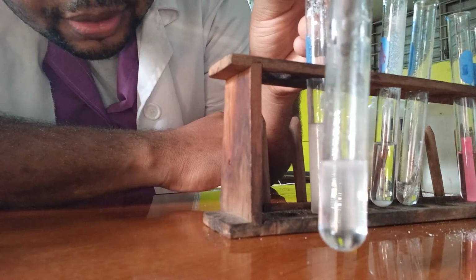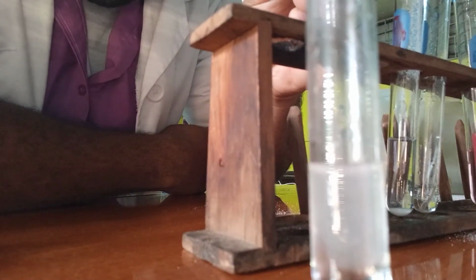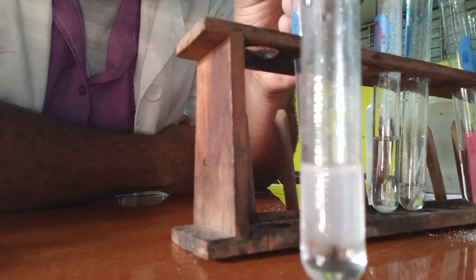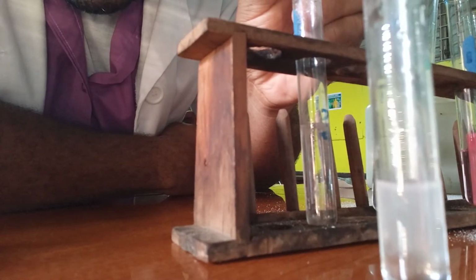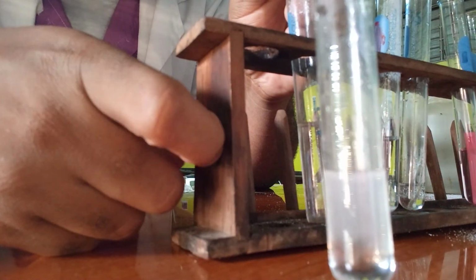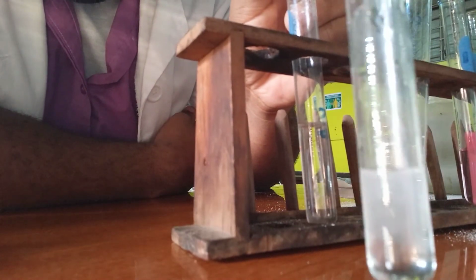You can definitely see it. We have the white precipitate being formed. It looks a little too cloudy, because the white precipitate is being formed. And you should know what that white precipitate is when you react calcium hydroxide with carbon dioxide. So this is a test for carbon dioxide gas. If it is present when you add it to the calcium hydroxide, you should get a white precipitate.